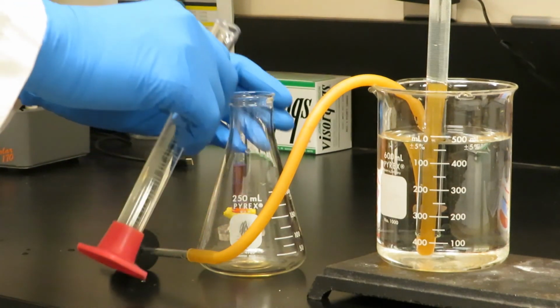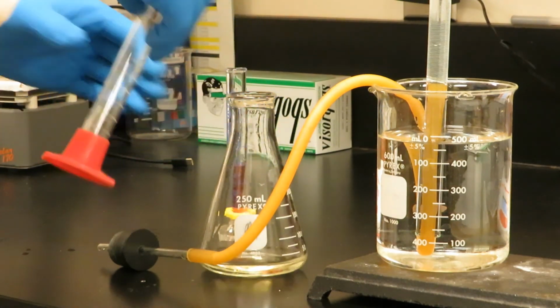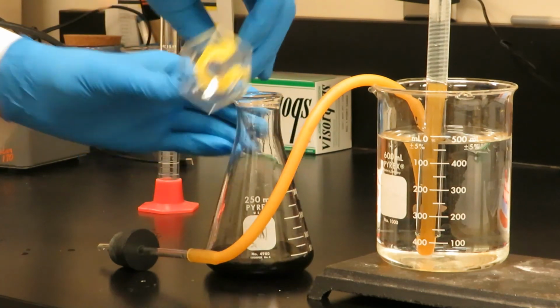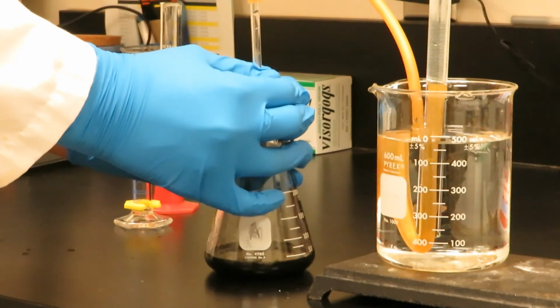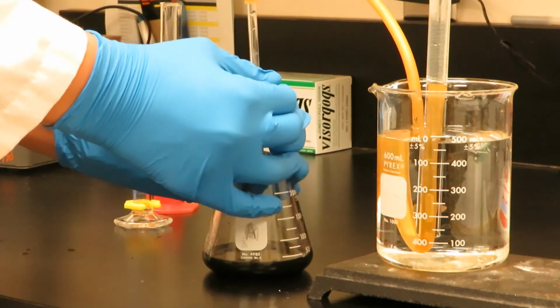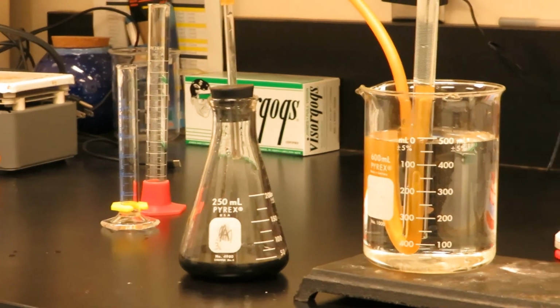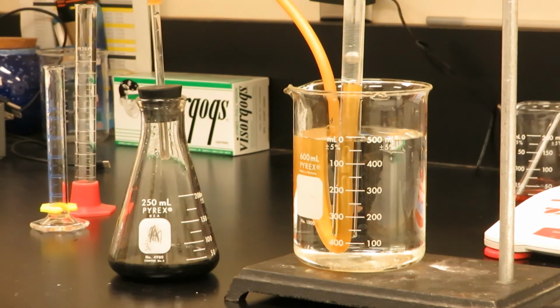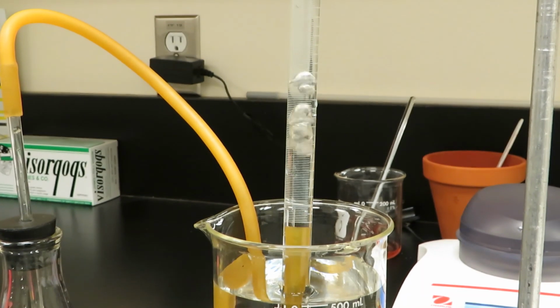So what you can see here is that I'm adding my reactants. That was the bleach, and then right there is the cobalt-2 nitrate. Immediately you see the precipitate form that is black. In the previous slide, we showed what that precipitate is. Put the rubber stopper on, and you'll see that the reaction slowly makes oxygen gas. You can see those bubbles going up through the rubber stopper, through the rubber hose. And right here is a better shot, you can see the bubbles getting collected into the gas collection tube.